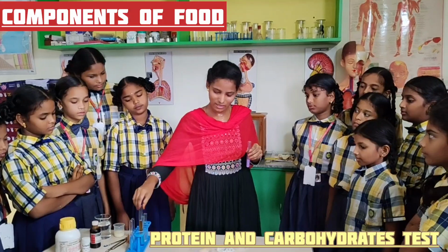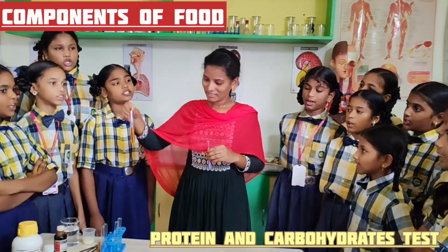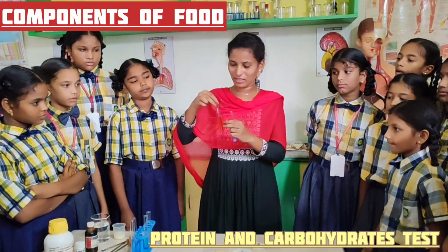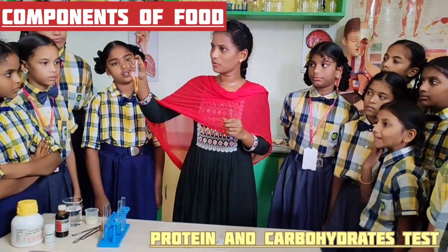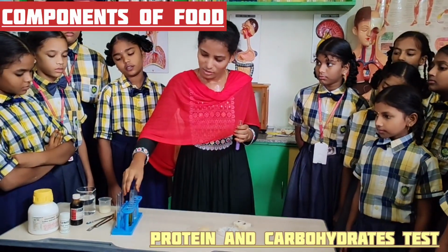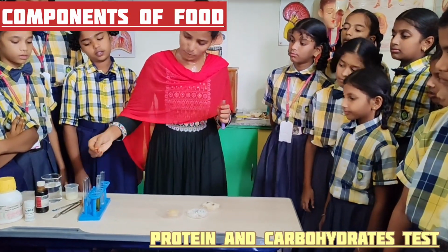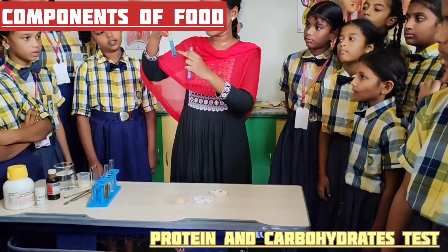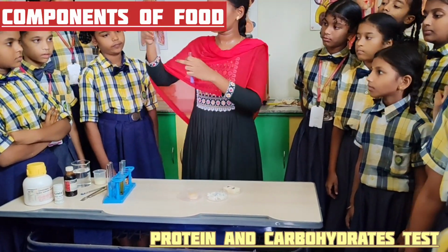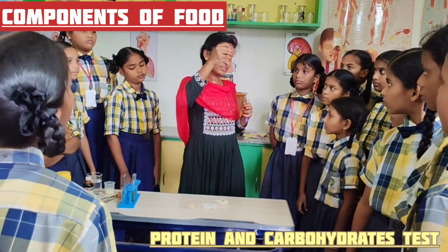Which solution is needed for carbohydrate test? Iodine solution. We took a half filled test tube of water and added a few drops of iodine reagent into it. And we prepared the sodium hydroxide and copper sulfate solutions by adding a spatula of copper sulfate crystals into half filled water and also one or two spatulas of sodium hydroxide pellets into half filled water in a test tube.